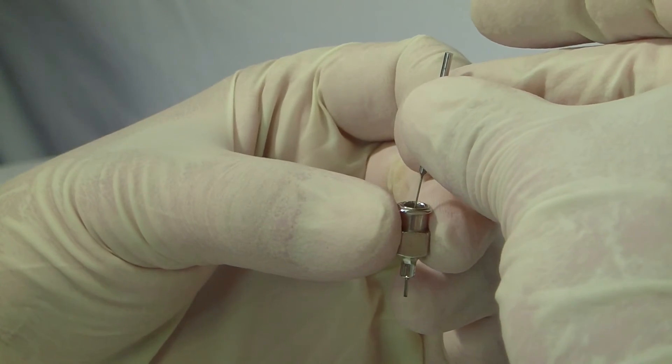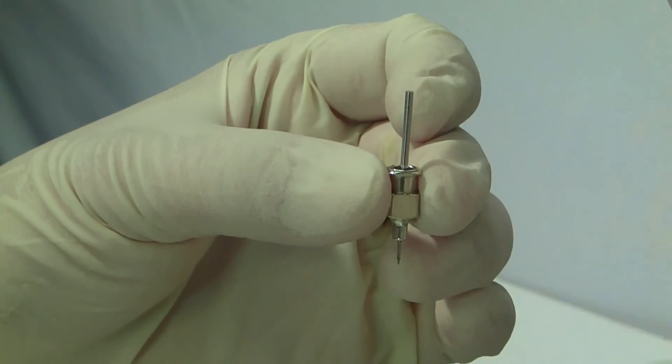Then, gently drop the test probe straight down. Be sure to let go of the test probe before it touches the bottom of the reference probe to prevent blunting the tip.